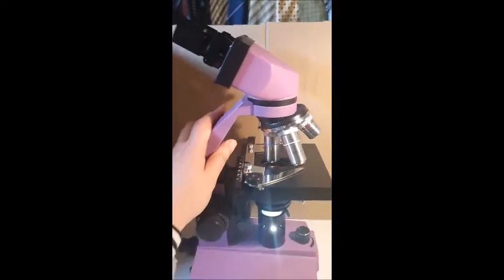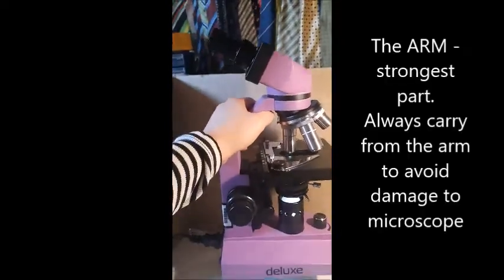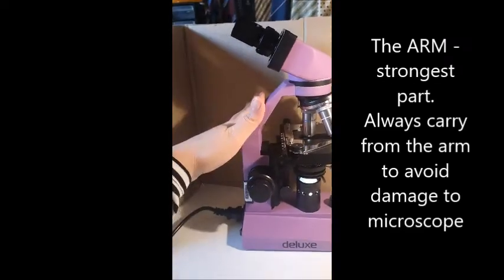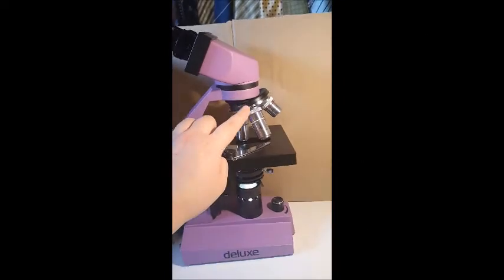Now, when we carry a microscope, we always hold it from here. This is the strongest part of the microscope. That's called the arm.